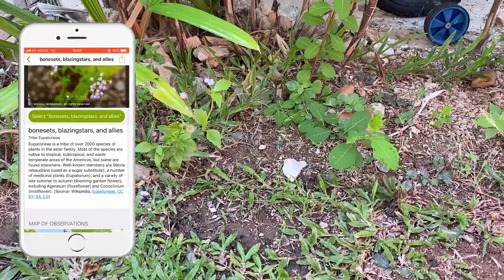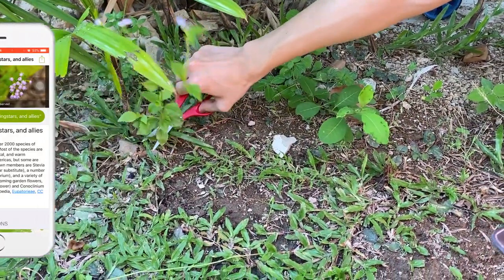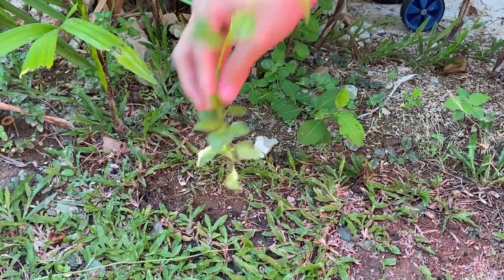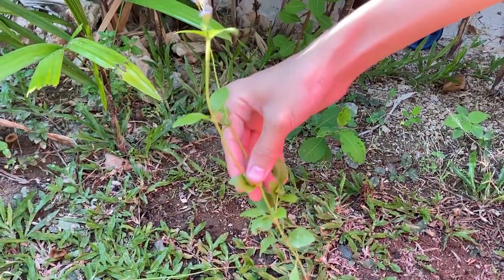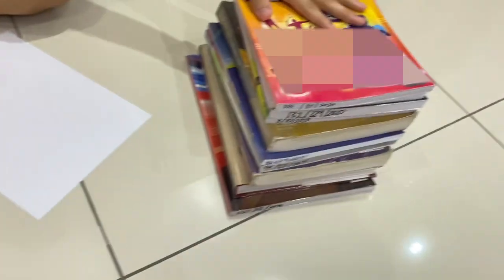Now I will cut out the plant. This plant will be used in the next step, which is the compression. For compression, what you need are papers, scissors, and maybe tape, and stacks of books.